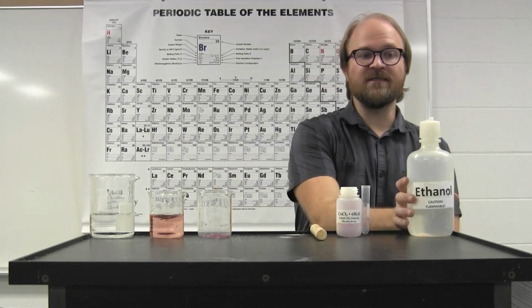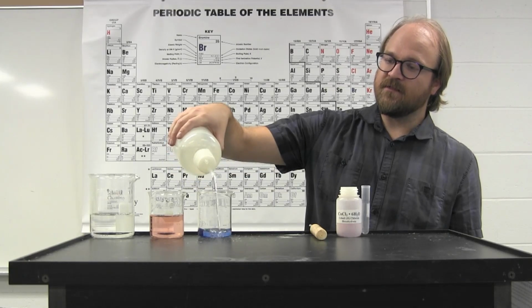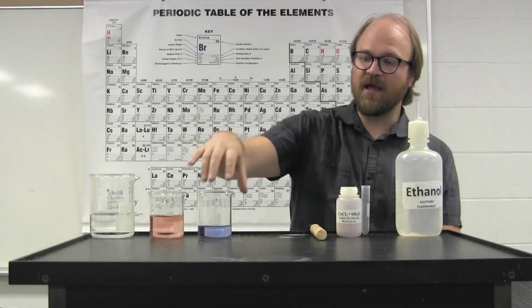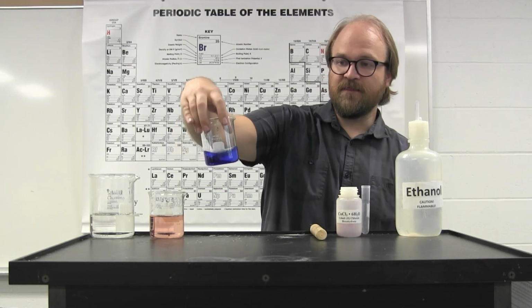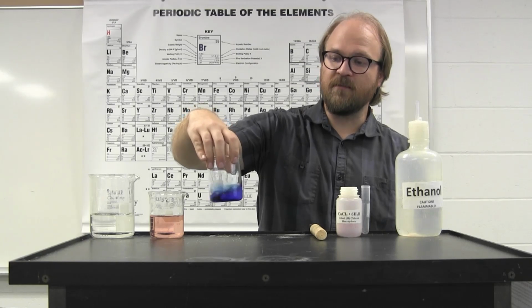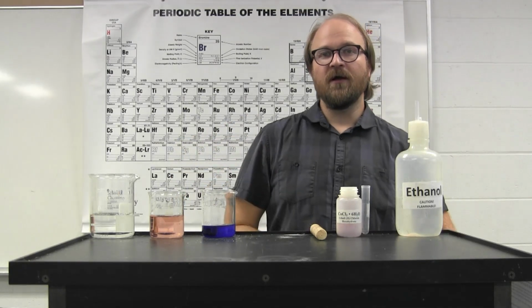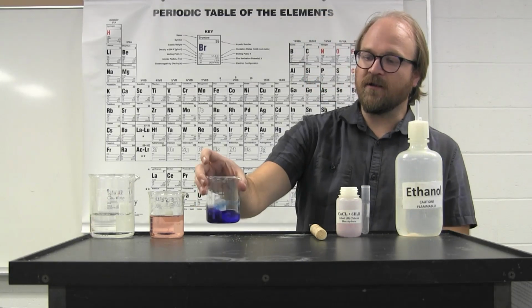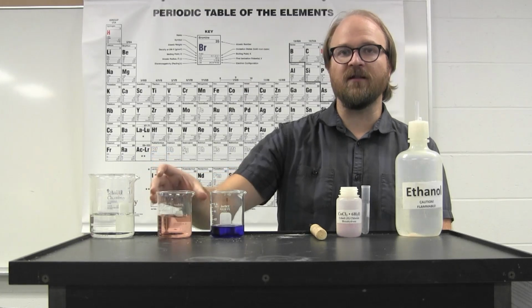However, if water is not involved and a solvent chosen is not water-based, such as anhydrous ethanol, the solution is a blue color. This blue color is where the term or coloring of cobalt blue comes from. Cobalt chloride in its pure state without water is a blue color, and it's only the presence of water that causes the red color to appear.